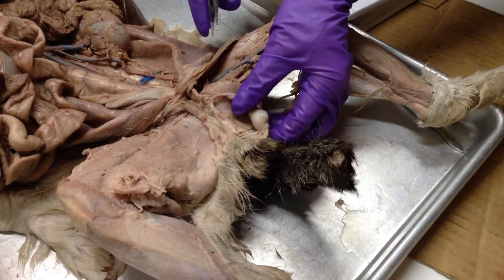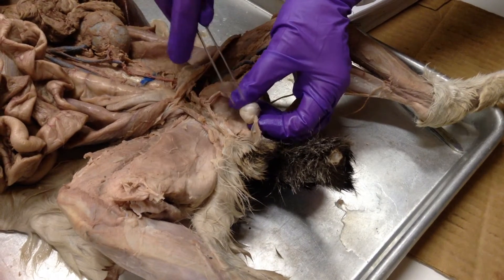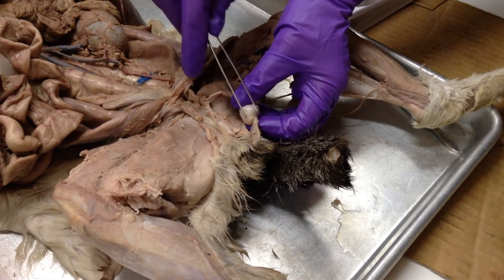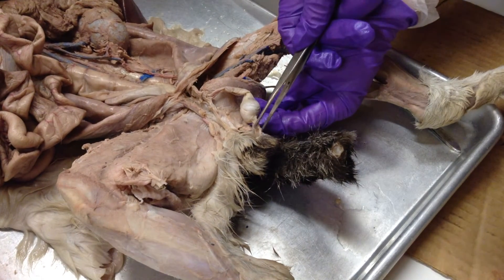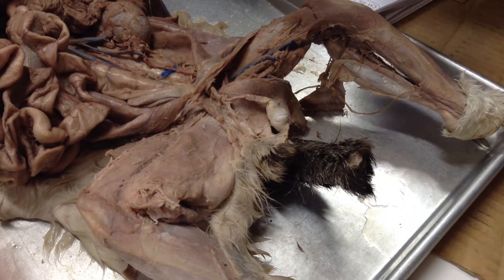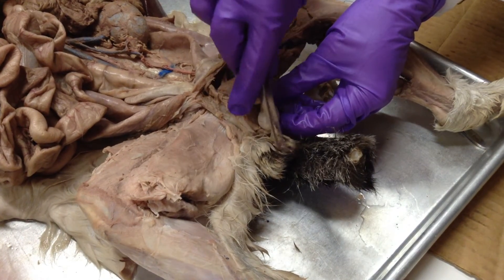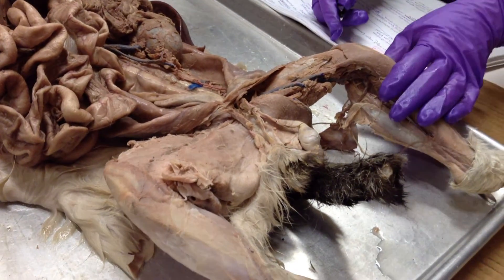You see this structure connecting the ball to the skin — the ball is the testes and the skin is the scrotum. There are ligaments connecting them called the gubernaculum. In this cat it's still attached, but in most cats it gets accidentally cut. The gubernaculum contracts and connects the testes to the scrotum. This is the only cat I've seen it intact in.